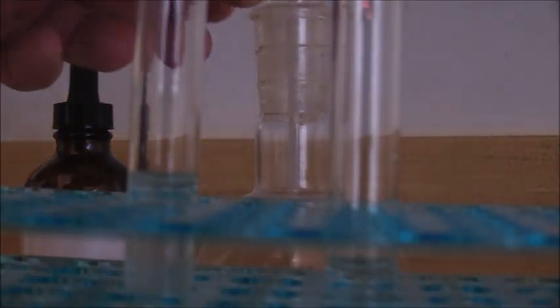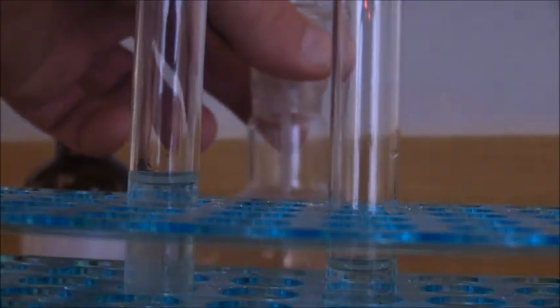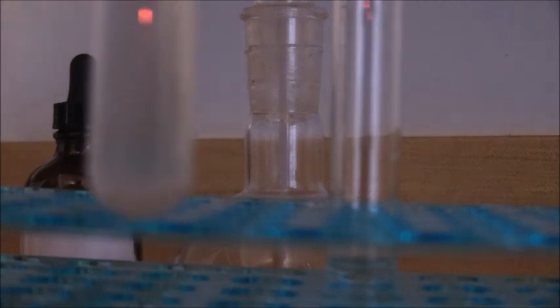So now we're going to test our solution for the presence of purines. As you can see here, this is the original solution. And we have our control sample, which I mixed up a solution of formamide, calcium carbonate, and sodium pyrophosphate. And there's a little bit of calcium carbonate residue at the bottom, because obviously calcium carbonate is not very soluble. And I took the liberty of adding ammonia to this solution, because ammonia is one of the reagents that's required for the purine test.